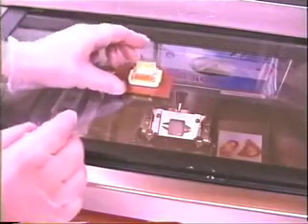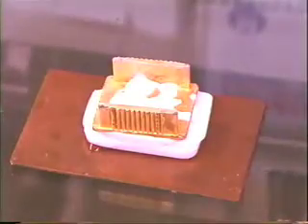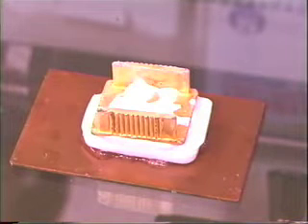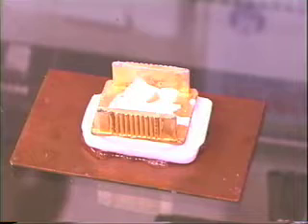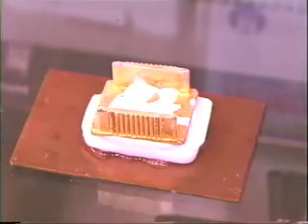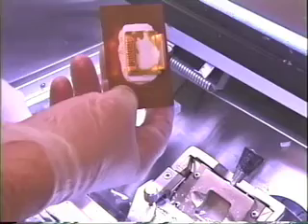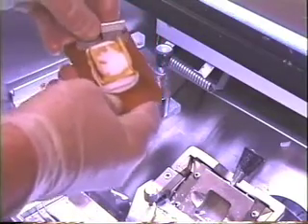The room temperature metal plate will cause the OCT to melt. This will take approximately 10 to 20 seconds. Melt until you see OCT around the edges of the array mold. Place the array and metal plate into a freezer or cryostat and allow the plate to freeze to the array. Once the two are frozen, you can carefully separate them. The array will now have a flat surface and the punches will be set into the OCT mold.